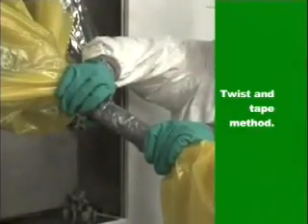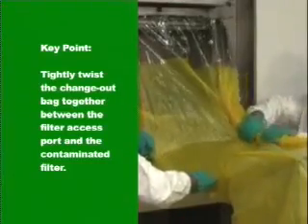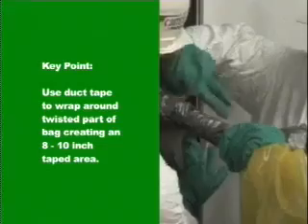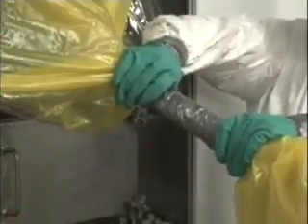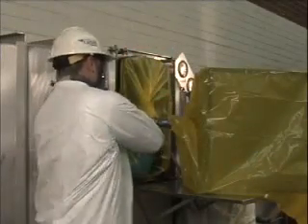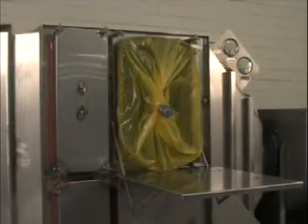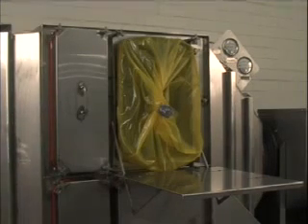An alternate method is the twist and tape method. Tightly twist the change-out bag together between the filter access port and the contaminated filter. Use duct tape to wrap around the twisted section of the change-out bag, taping approximately 8 to 10 inches of the bag as tightly as possible. Cut completely through the change-out bag in the middle of this section, leaving a stub bag on the bagging ring of the housing. Tape over the exposed edges where the bag was cut. Remove the contaminated filter in the bag for disposal.